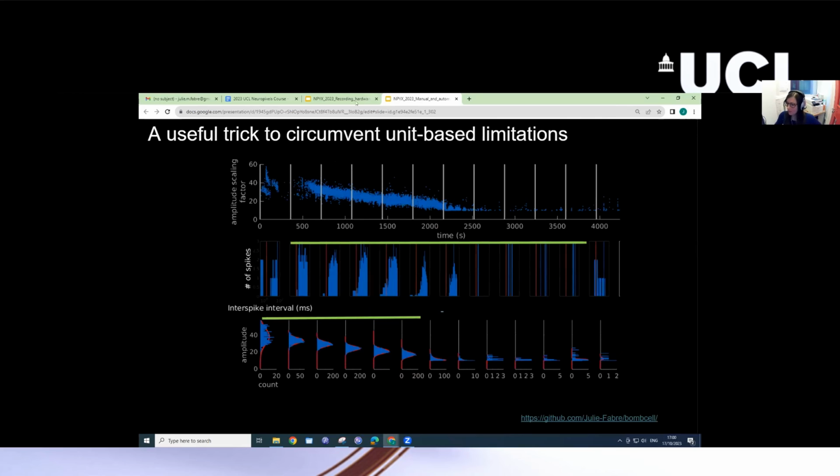And now I just really quickly want to say that, as I said, quality metrics are only unit-based. There's a slight trick you can do to make that a little bit better, which is to separate your recording into different chunks, which is what BombCell does, or it's an option in BombCell, and then compute quality metrics on these separate chunks. So here is plotted the interspike interval. Any bins here that are in front of this red line correspond to refractory period violations. You can see that this first bin has a lot of refractory period violations and the ones after it do not. So you would typically want to select these bins.